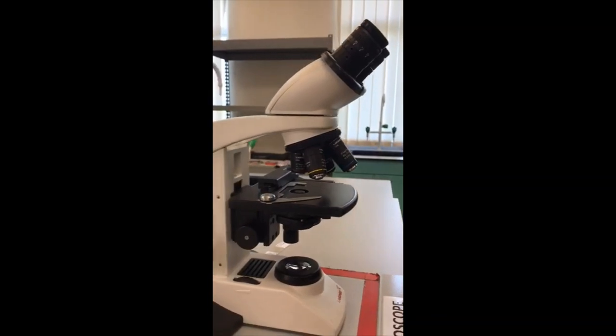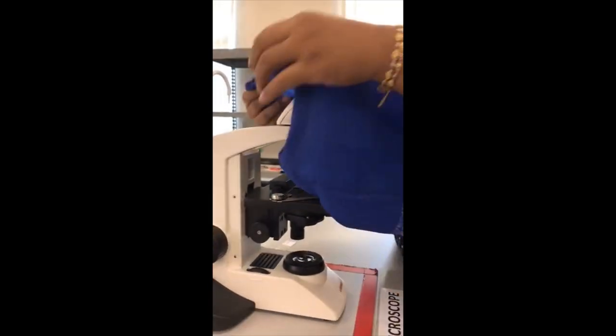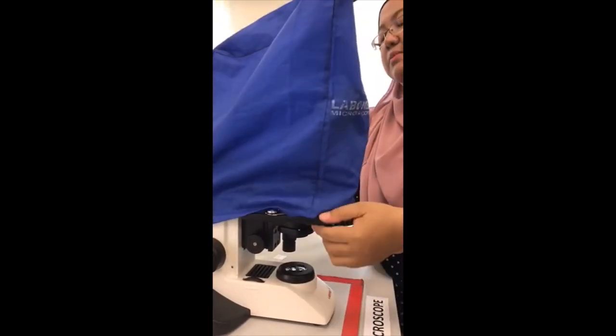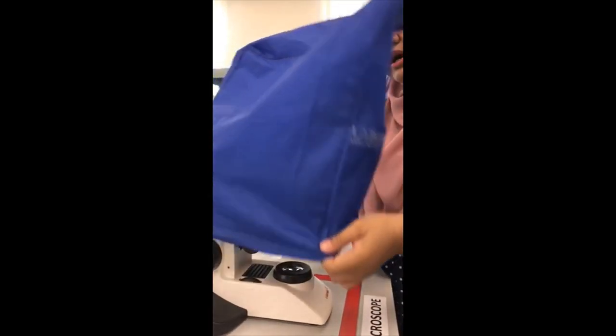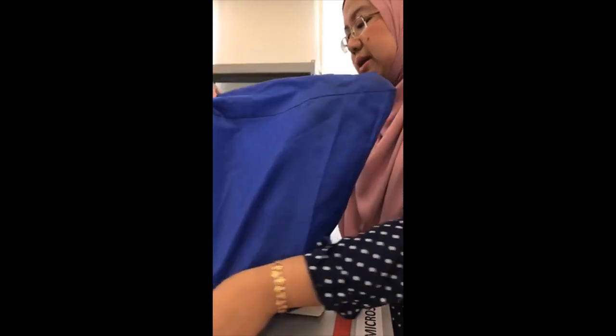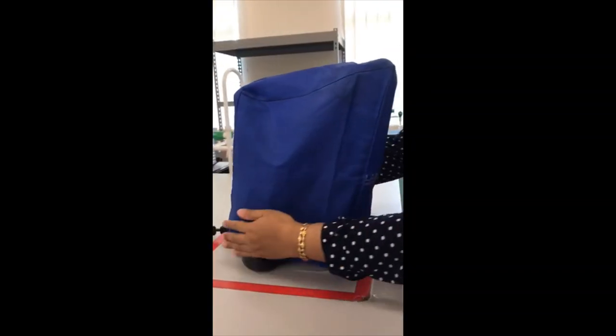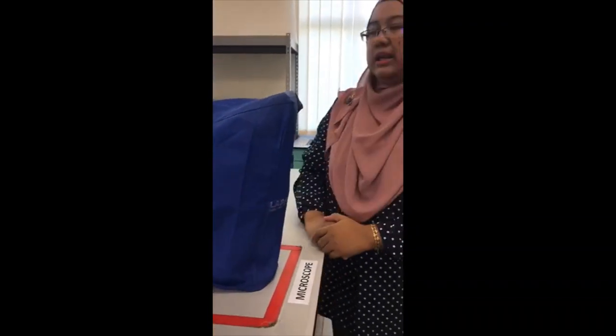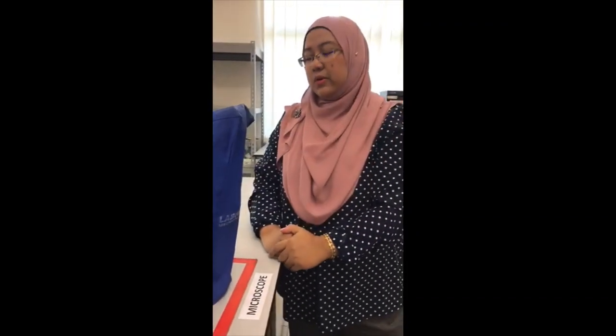Cover it back with the light microscope cover. Place it properly so that the cover covers all parts of the light microscope.